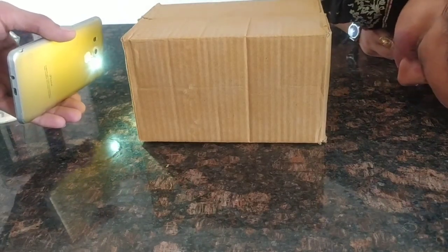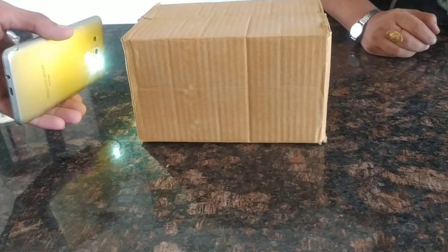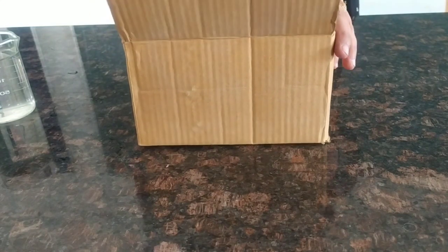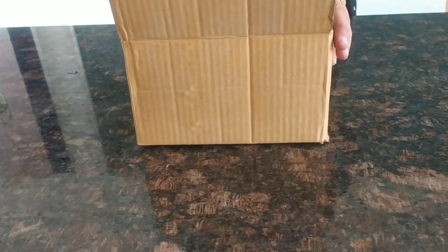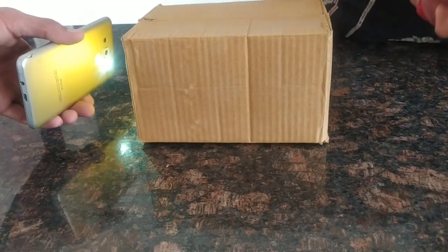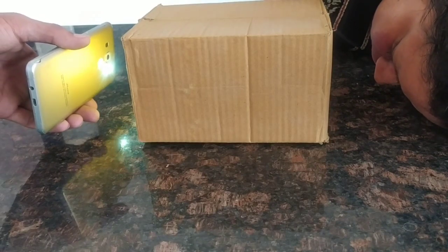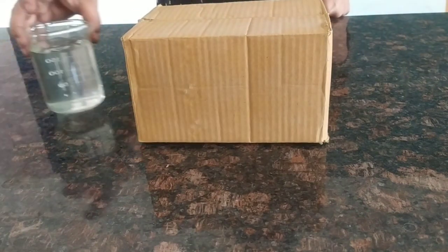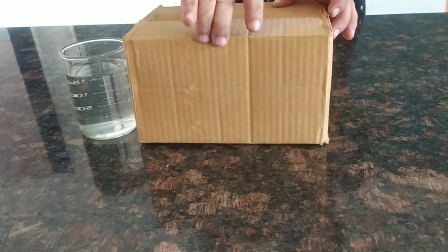We will throw light from one side through the hole and observe it from the other side. For this experiment, we have to make sure that the room is dark. I'll carry out the same procedure with the tap water — place the beaker inside the cardboard box, throw light from one hole, and observe the clarity of water from the other hole.